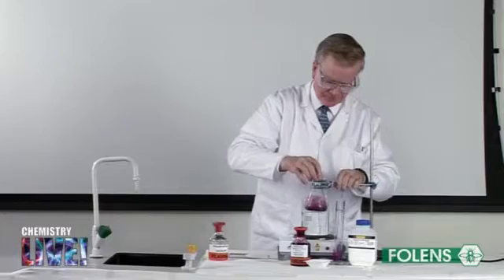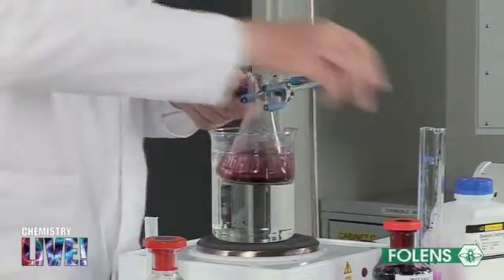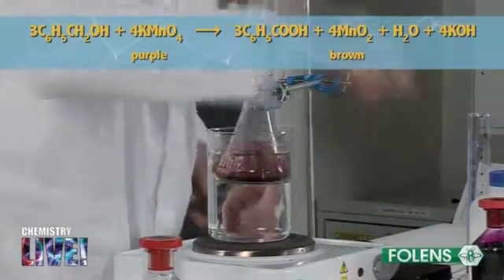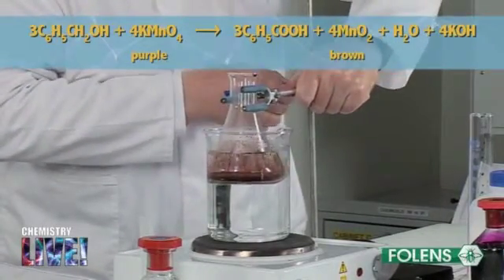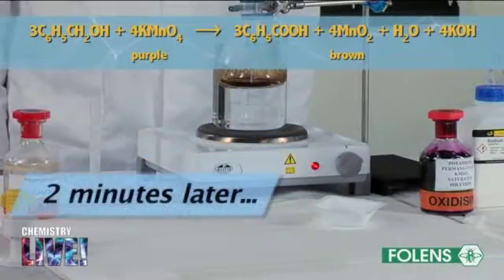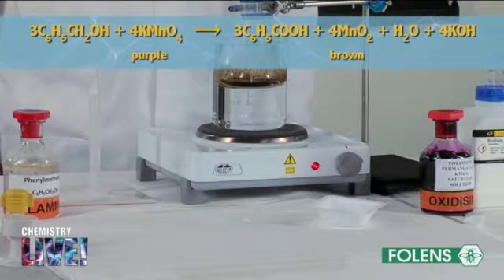The next stage involves heating the reagents to get the reaction to take place at a reasonably fast rate. The conical flask is clamped in a beaker of boiling water for about 20 minutes. As the reaction proceeds, the colour changes from purple — the colour of the manganese ion in an oxidation state of +7 — to brown, the colour of the manganese ion in an oxidation state of +4. That is, there is a reduction of manganese from oxidation state +7 to oxidation state +4. The phenylmethanol is oxidised to benzoic acid. Note also that a brown precipitate is formed.